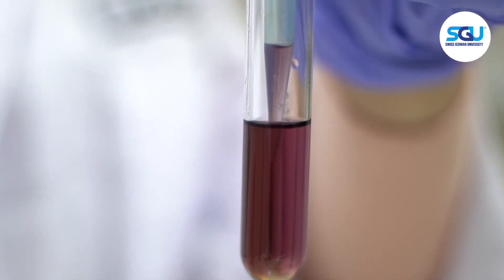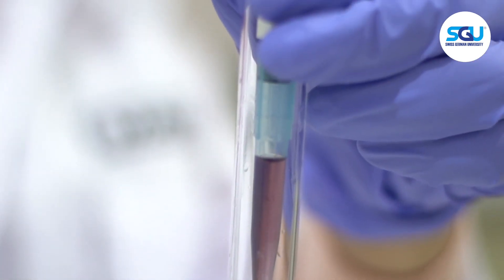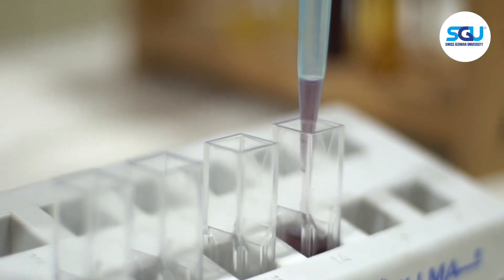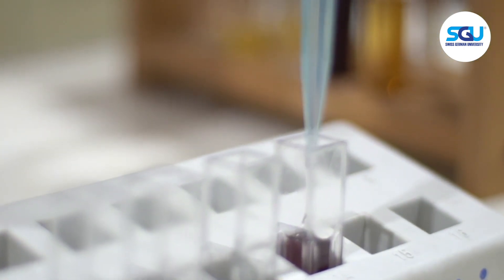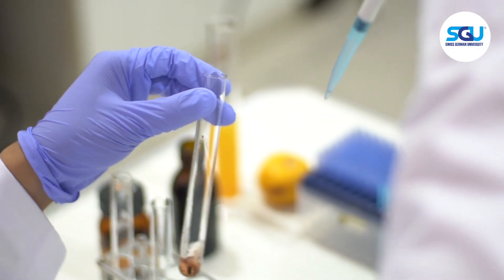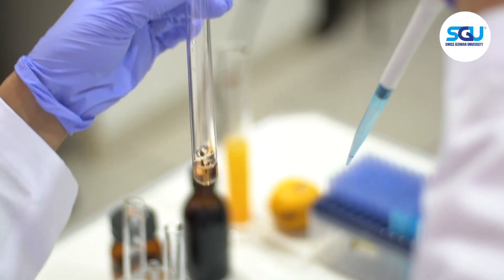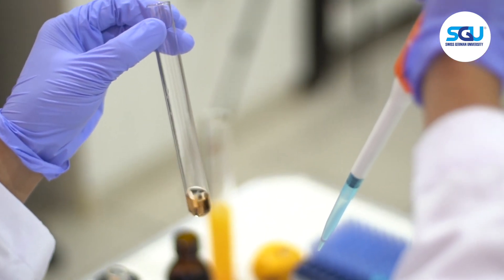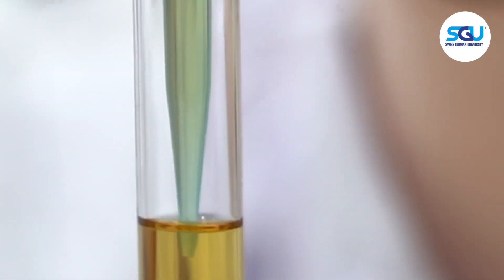The solution was transferred into different cuvettes. The first cuvette contained orange juice mixture. The second cuvette contained commercial vitamin C drink.